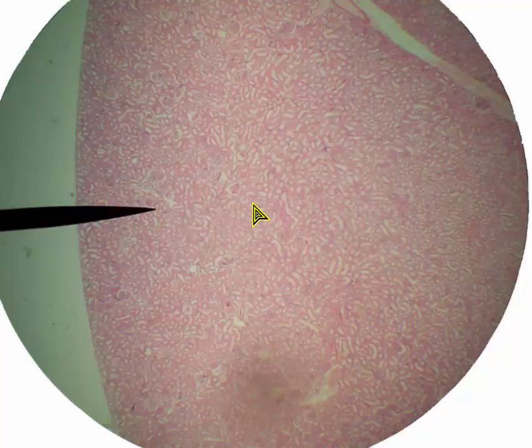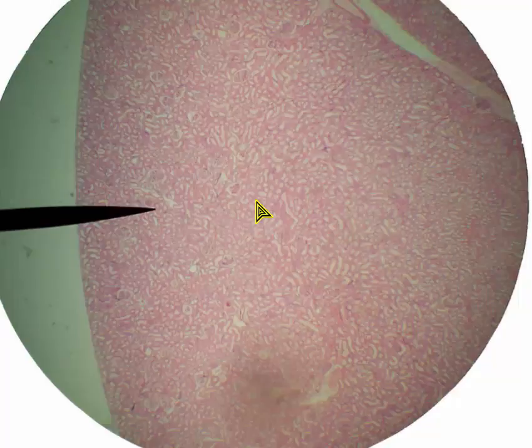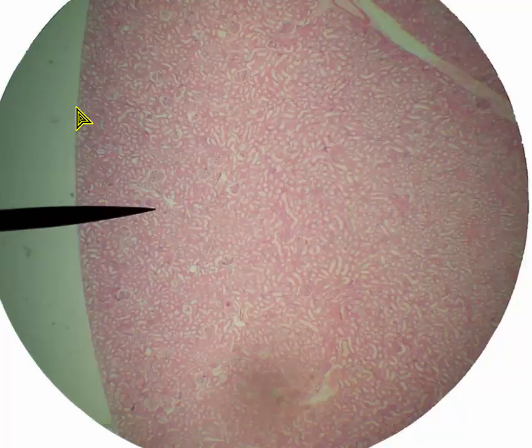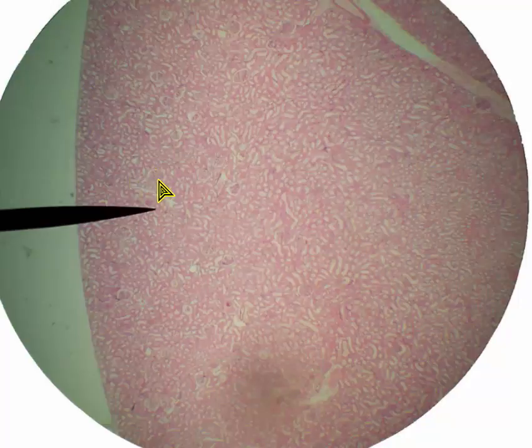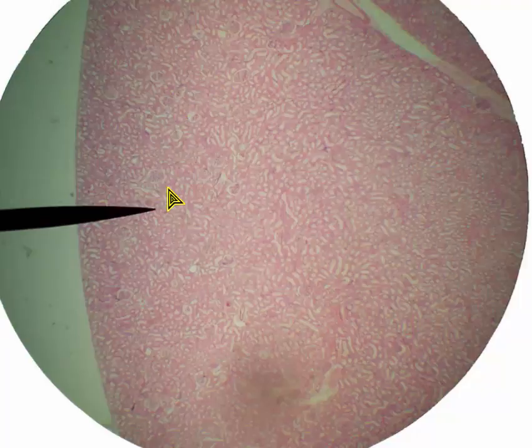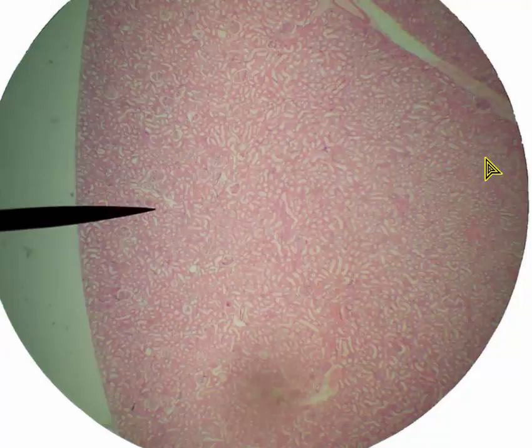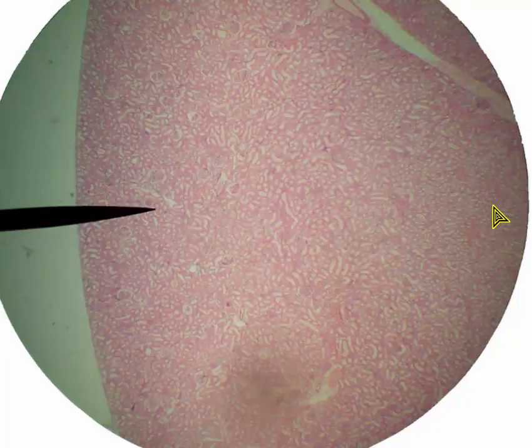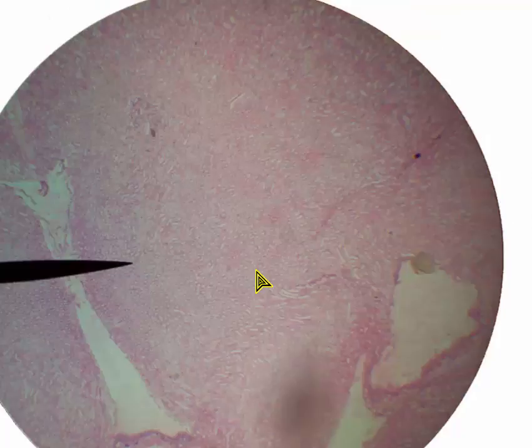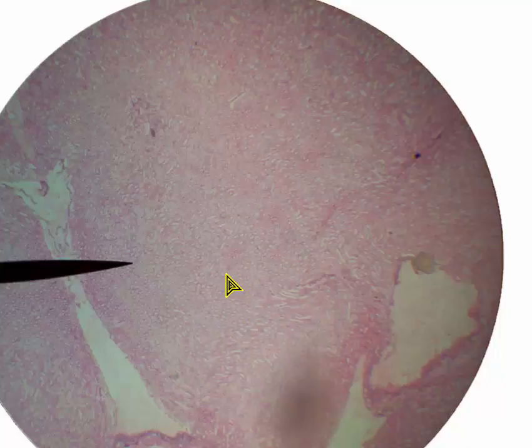Here's that mouse kidney again. Name the organ that the section comes from — that's kidney. How about if I put the pointer out here? That would be renal capsule. Name the structure — the answer is renal corpuscle. Name the region — the answer is renal cortex. And then name this region — the answer is medulla or renal medulla or medullary region. Moving on: what region of the kidney are we looking at here? Again, that's medullary region or medulla.